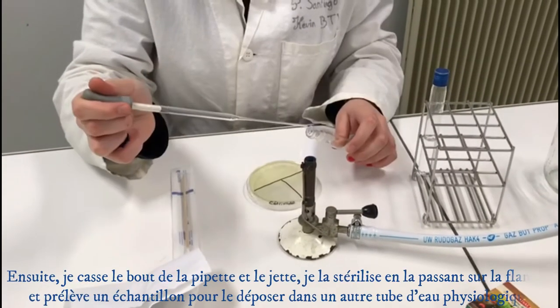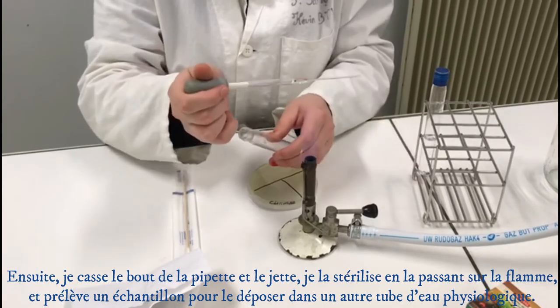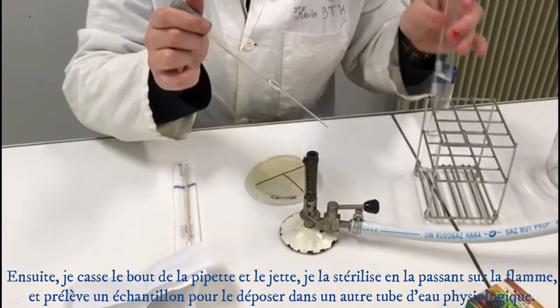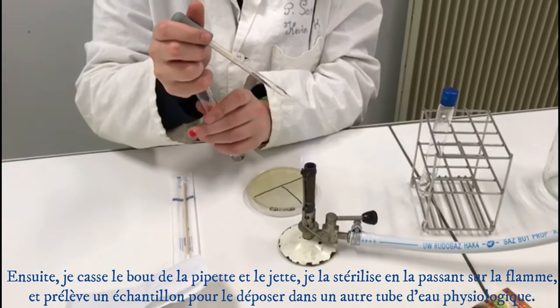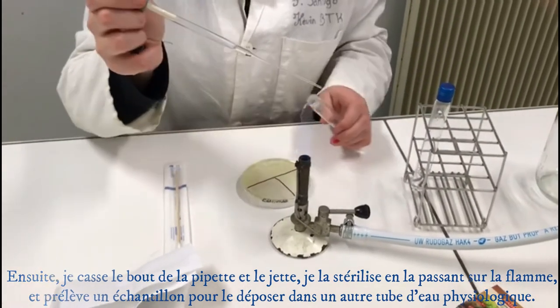Next, I snap off and discard the tip of the pipette, sterilize it by passing it through the flame. Then I take a sample and put two drops into another tube of physiologic water.